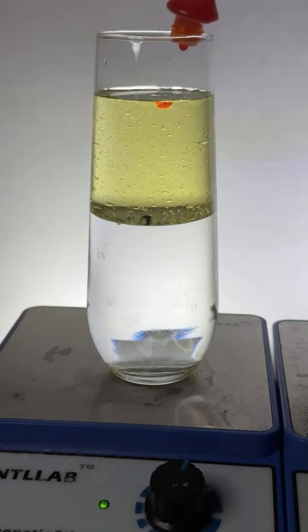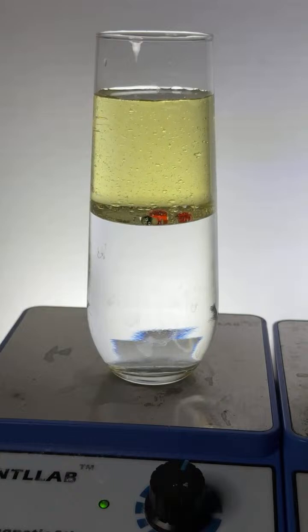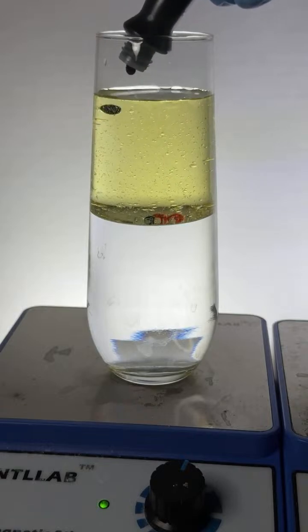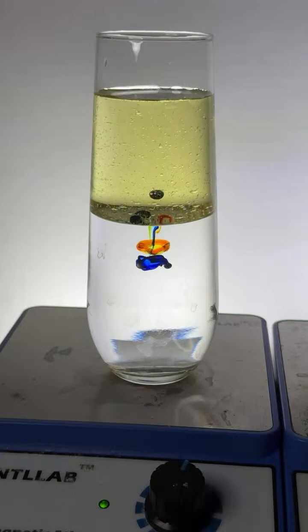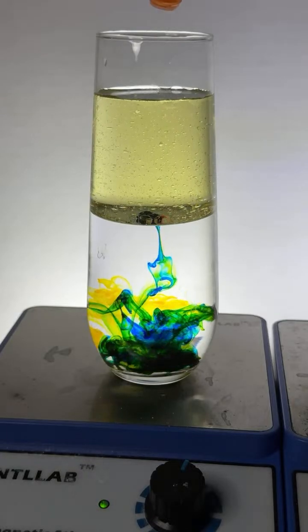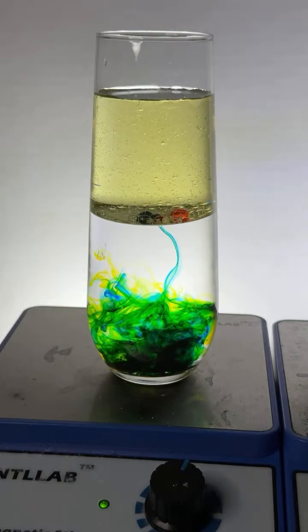Let's do, I don't know, 3 drops. Oh, look at those going down. Those are bigger. That's interesting. All right, 2 more drops of blue, maybe. 1 over here, 1 over here. Down they go. Let's just do 1 more each. 1 right in the middle, blue. And oh, look at that. That was beautiful. It just kind of popped and went. All right, see if the other 2 pop.